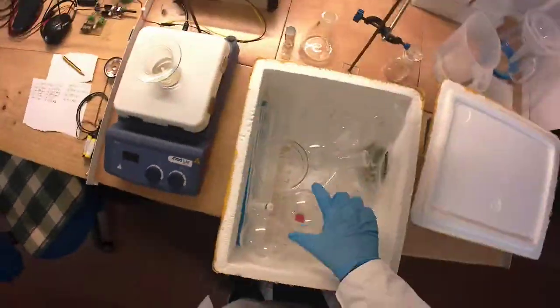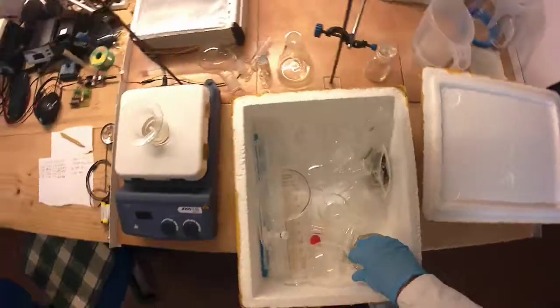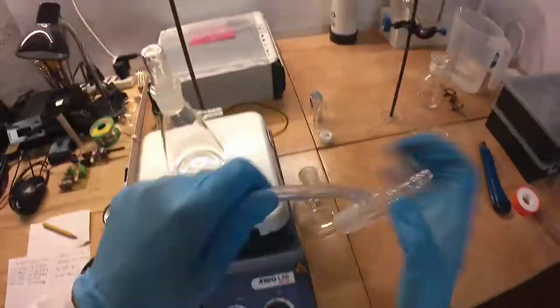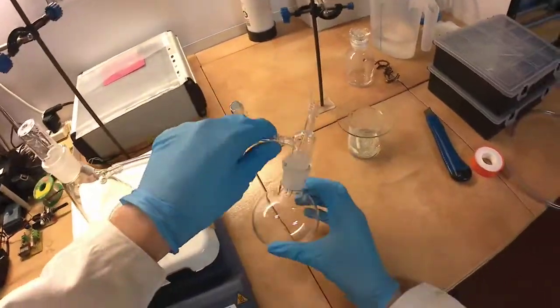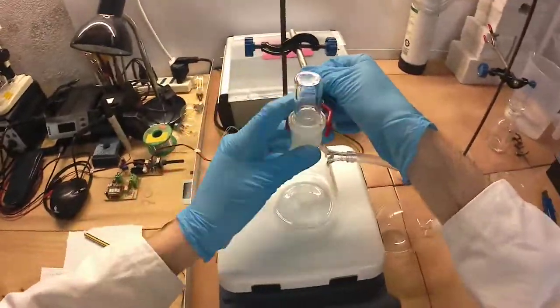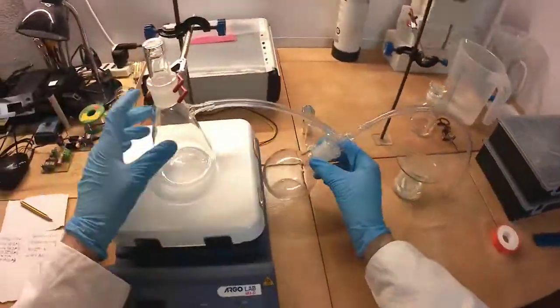This is the most dangerous part of the process, as the reaction liberates nitrogen dioxide, which is a toxic gas. Although the scale of this reaction was quite small, my fume hood wasn't complete at the time when I made this experiment. So instead of performing the reaction in a beaker, I assembled this closed apparatus with a suck-back trap and sodium hydroxide scrubber to absorb the nitrogen dioxide.